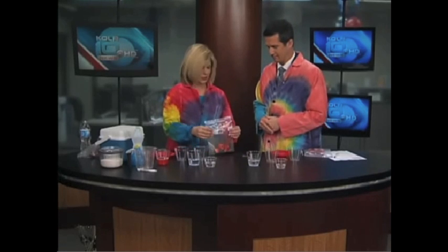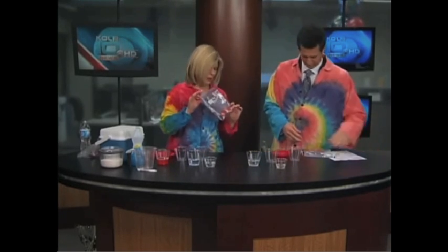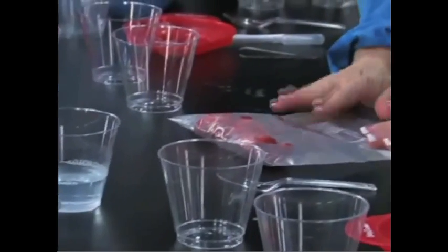We are learning about DNA this morning. Terri Johnson from the Quircles joins us. We're not doing human DNA — we are using strawberries today. Actually, strawberries have more DNA than any other fruit. They are octoploid, which means they have eight different copies of each type of DNA chromosome. That's why we're doing it.